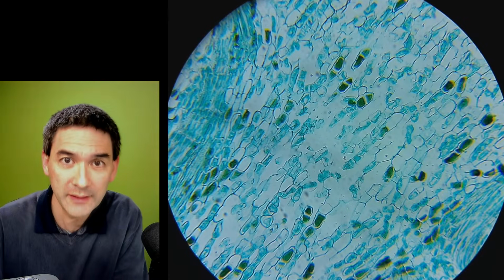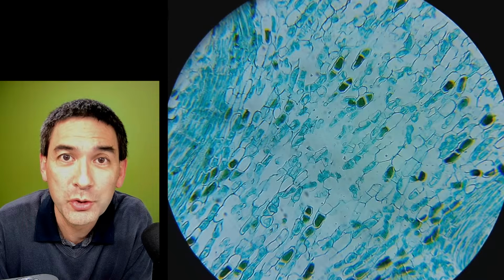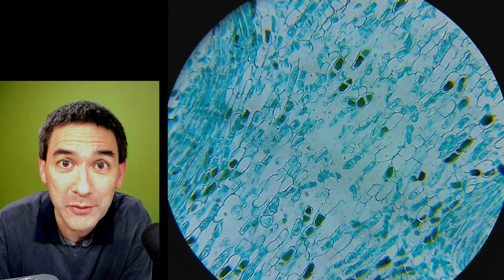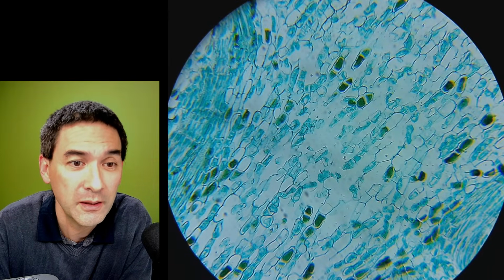Hi everyone, and welcome. Today we're going to do a little bit of hardware. I would like to show you 7 mobile phone camera adapters for microscopes. And as a matter of fact, I've already got one connected over here.